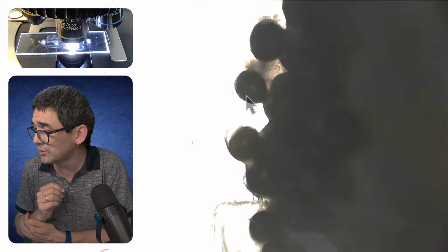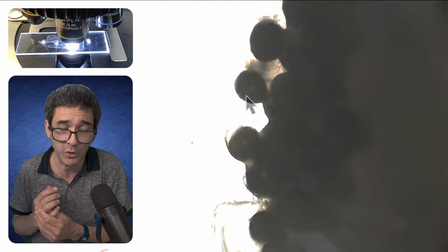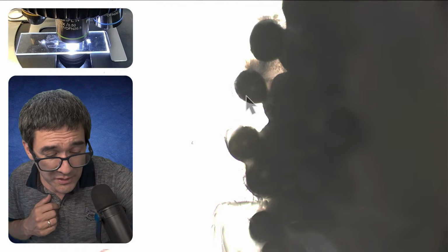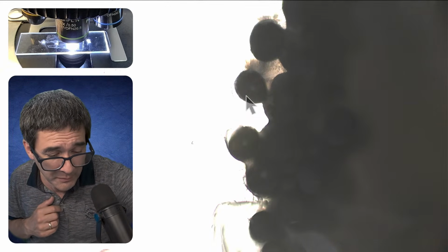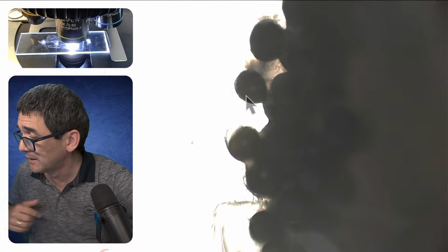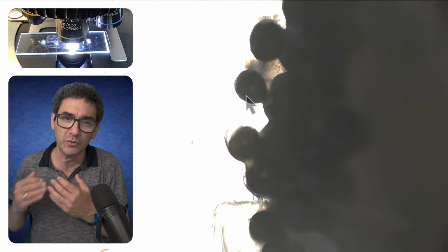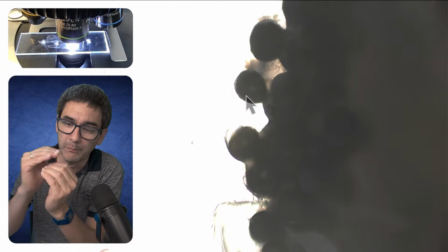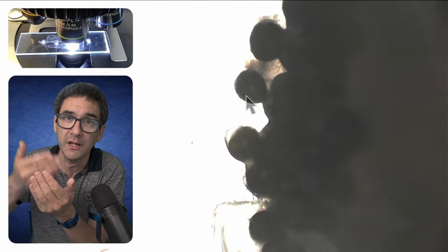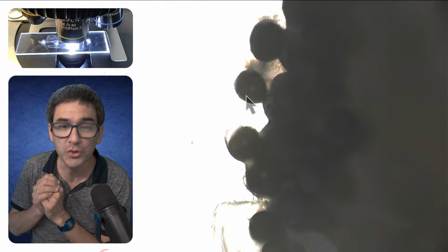Perpendicular top illumination. I tried using my stereo microscope, and the problem with the stereo microscope is that it is too small. That is the problem that I have, and I don't have a very strong flashlight with me. But that is something I'm trying to work on. I want to make perpendicular cuts, transverse cuts, so to say, through very thin objects. It's too small with the stereo.